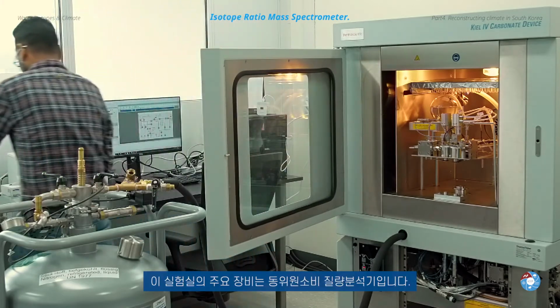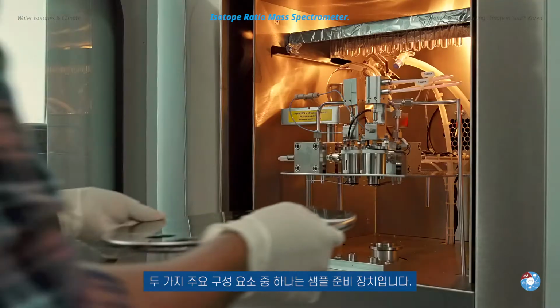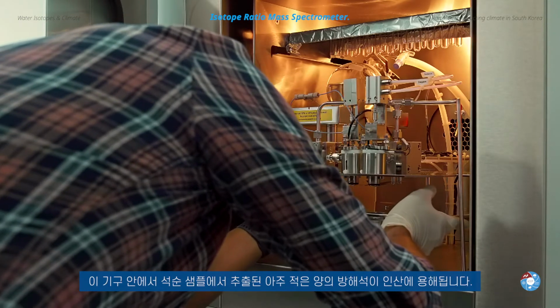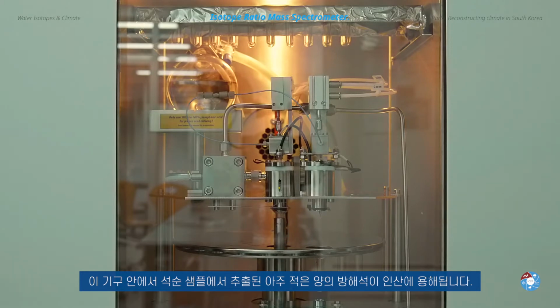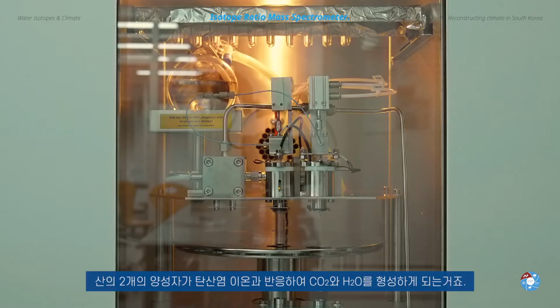Our main instrument is an isotope ratio mass spectrometer. It has two main components. One is the sample preparation device. In this instrument, the tiny little amount of calcite that we drilled from the stalagmite sample gets dissolved in phosphoric acid. The dissolution of calcite in acid generates CO2. Essentially, two protons in the acid react with the carbonate ion to form CO2 and H2O.